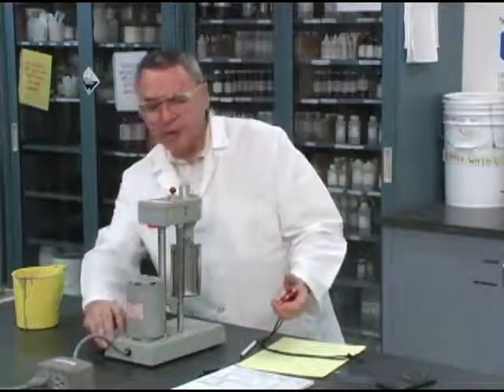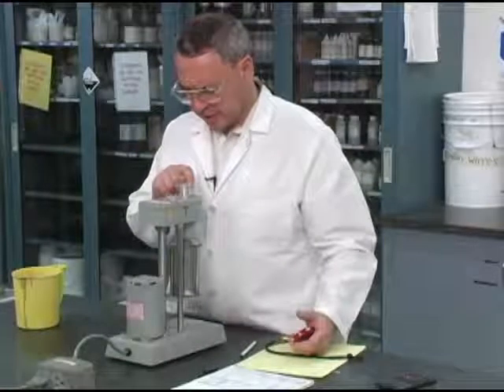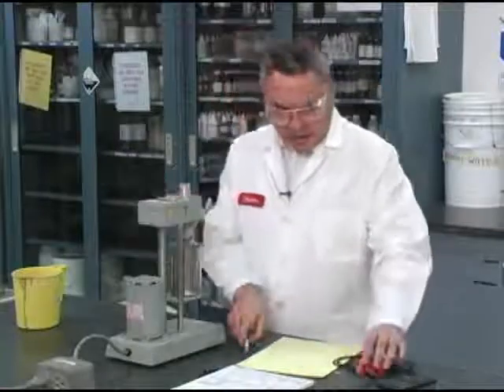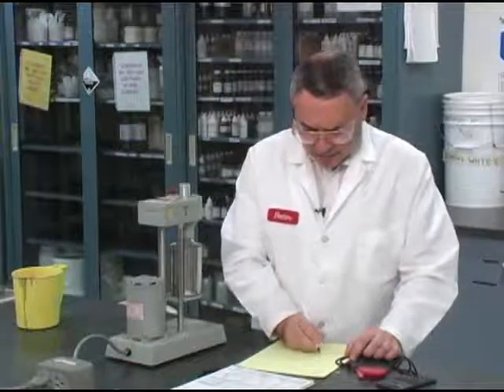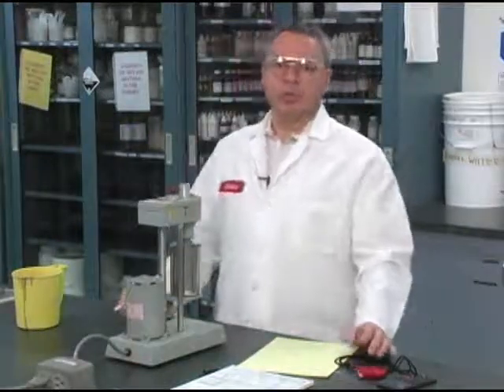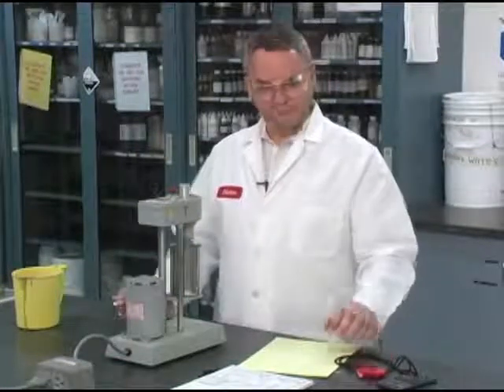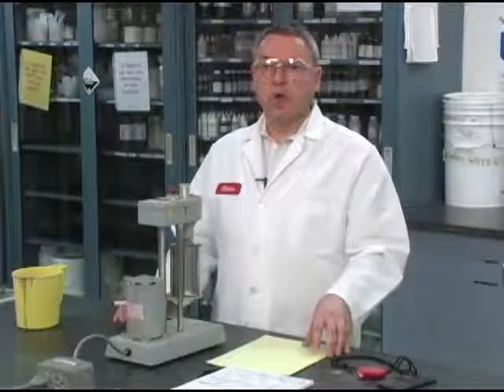So I'm going to the low, rotating at 3 RPM and paying attention to the maximum deflection here, and I can see that it peaked at 6. So my 10-minute gel comes to 6 dial reading, which corresponds to 6 pounds per 100 square feet. And this concludes our determination of rheological values.